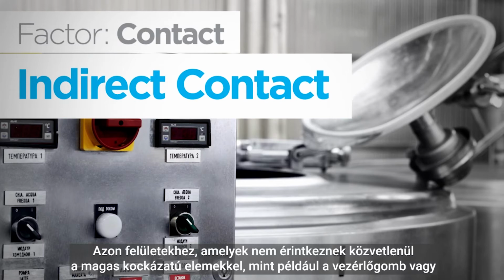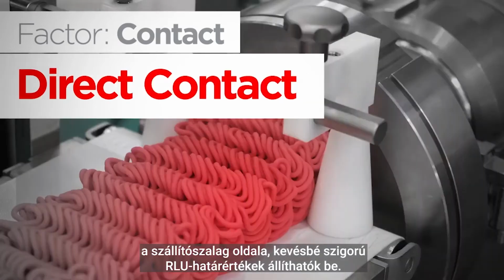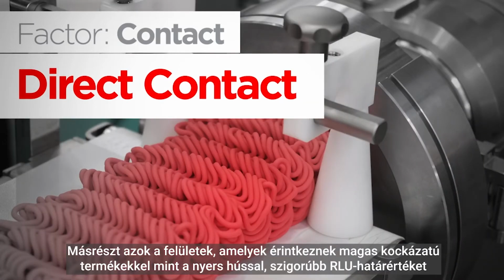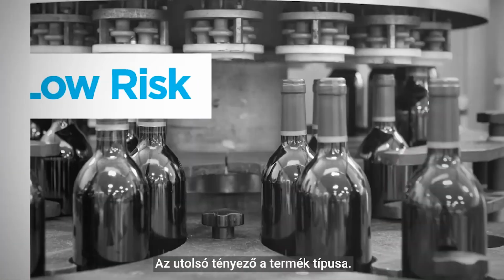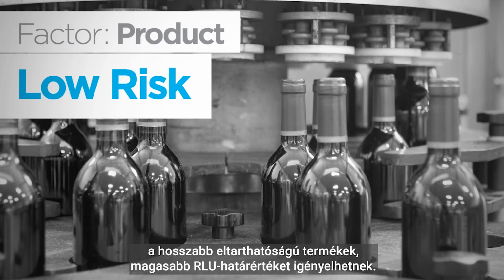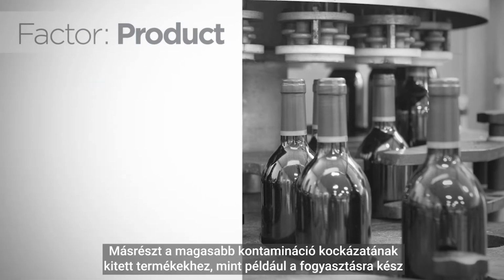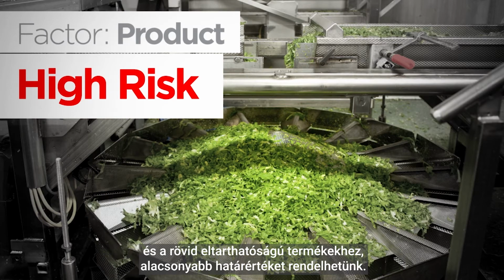The next factor is direct contact versus indirect contact surfaces. Surfaces that do not have direct contact with high-risk products, such as a control button or the side of a conveyor belt, may allow less stringent RLU limits. On the other hand, surfaces that do have contact with high-risk products, such as raw meat, may require stricter RLU limits to ensure cleaning interventions are effective. The last factor is the type of product. Products with a lower risk of contamination, such as cooked products or products with a longer shelf life, can have higher RLU limits. On the other hand, products with a higher risk of contamination, such as ready-to-eat products and products with a short shelf life, may require lower RLU limits.